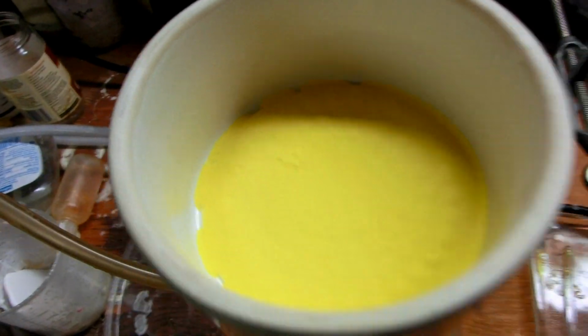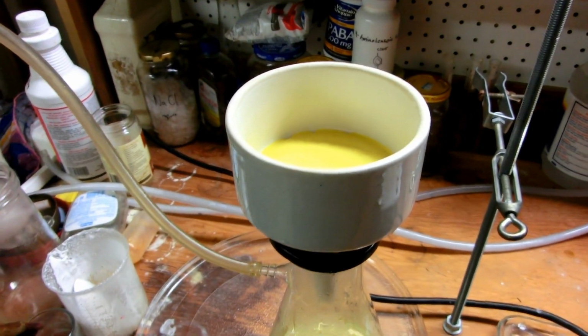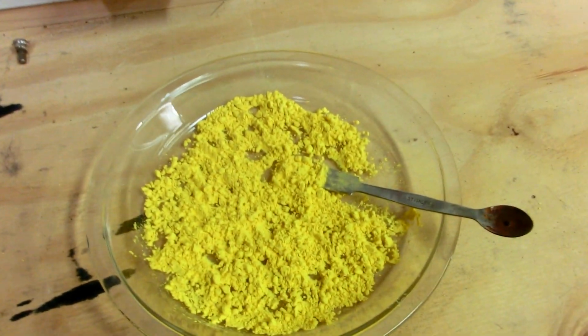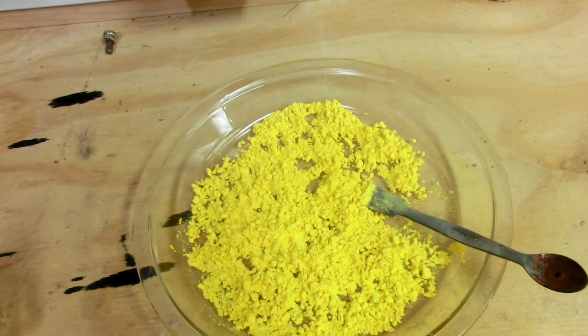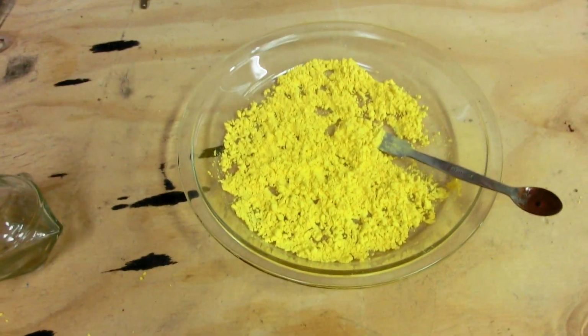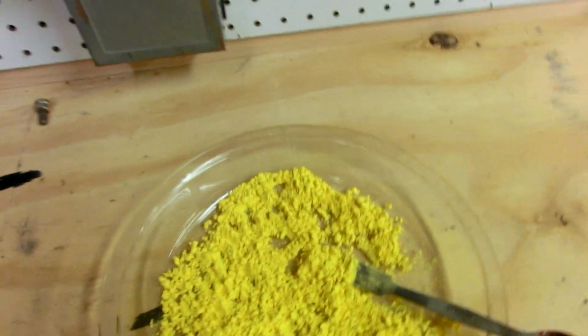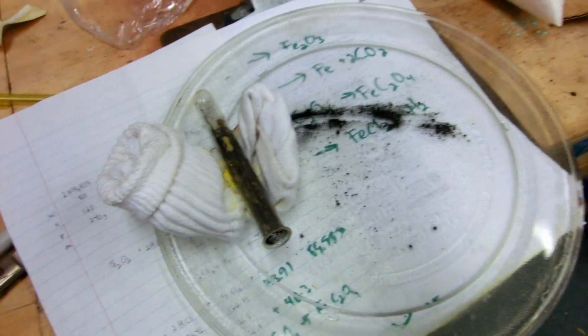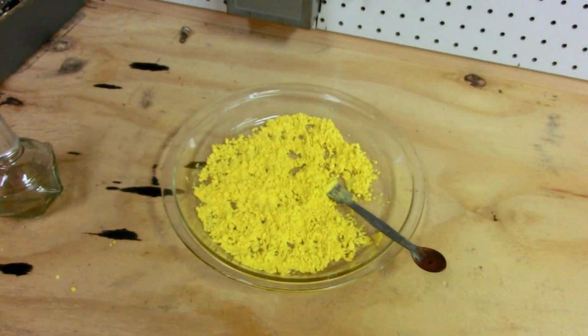So this method does in fact work, and in fact I scaled this up not too long ago, and over here I just so happen to have a big old batch of iron oxalate, which is now drying. And I took this whole video before, but I didn't like it, so I redid the whole thing. And this is basically the end of the part I needed to redo. And so in a couple of seconds, I'm going to play the video where I demonstrate the pyrophoric properties of iron by decomposing the oxalate in a test tube. So you can go check that out right now.